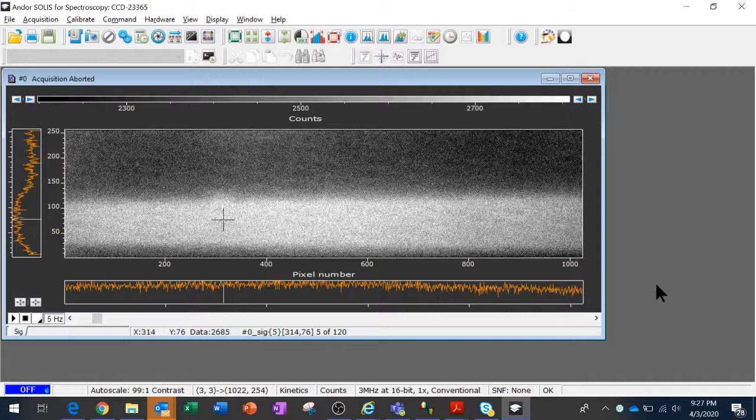And in this short video I want to show you how cooling improves the sensitivity of a CCD, or more generally any camera. The camera I have connected right now is a Newton 920 BEX2DD. At the moment I have the cooling off, so there's a thermoelectric cooler in this camera, a multi-stage one, and right now it's set to off. I have a little cooling status window here to show that it's not doing anything right now. So the camera and the chip inside are somewhere close to room temperature.